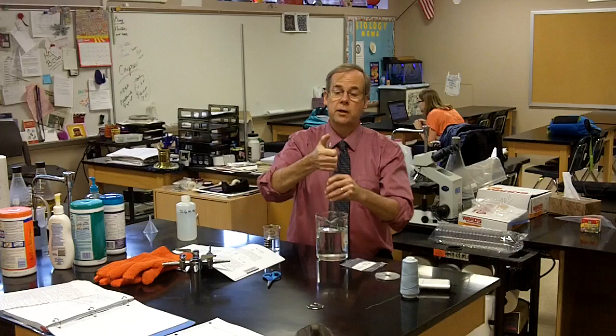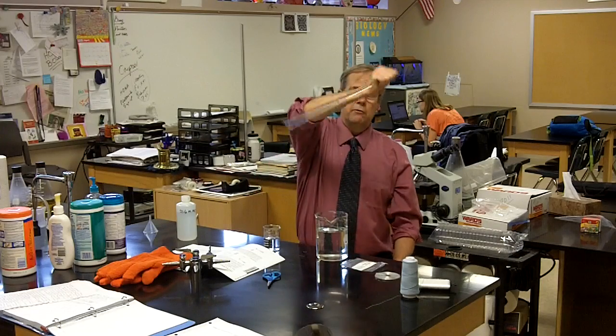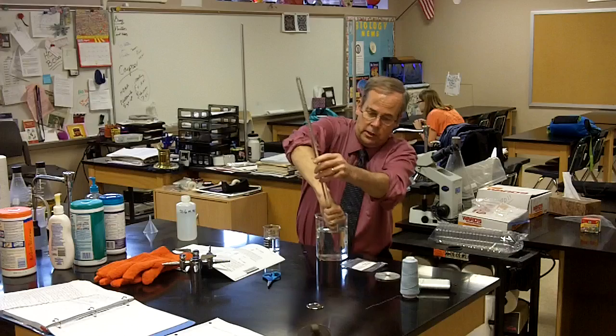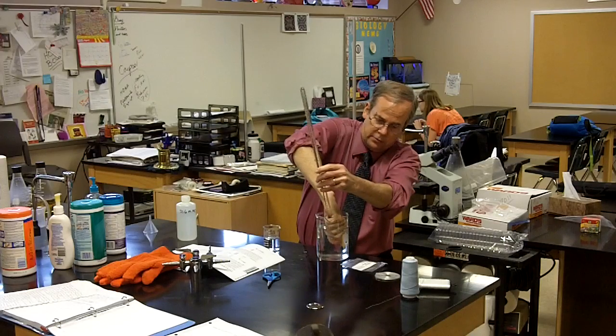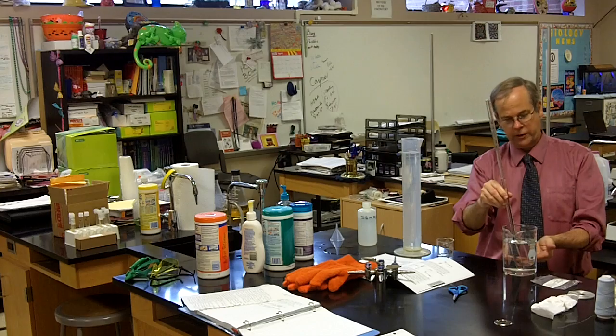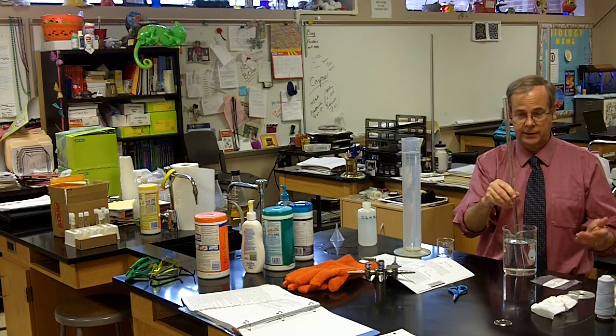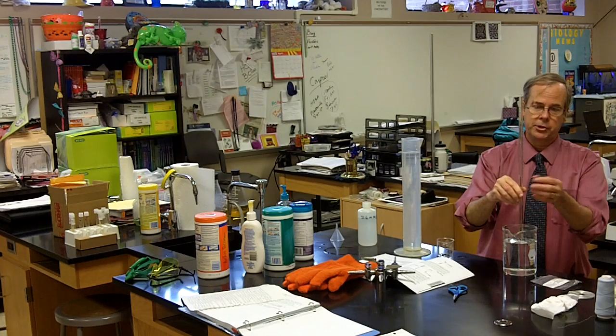Then I place my thumb firmly over the edge, nothing gets in or out. Invert the tube, lower it into the water, release my thumb. The reaction is complete when I observe at the bottom that all of the magnesium has dissolved and reacted and there's no further bubble formation.